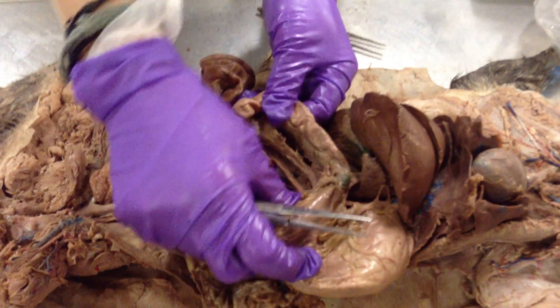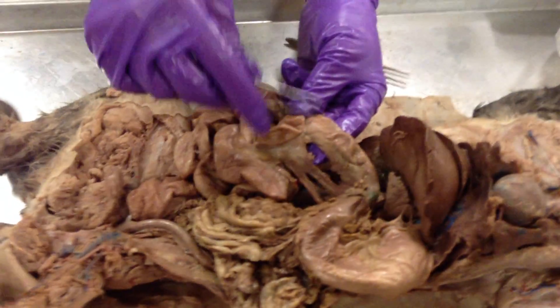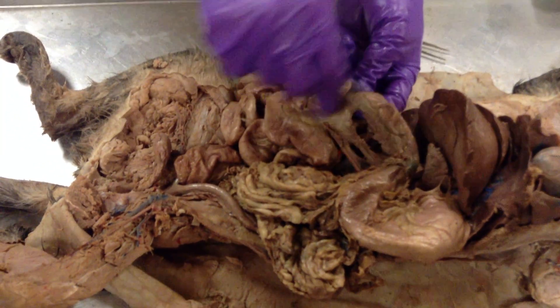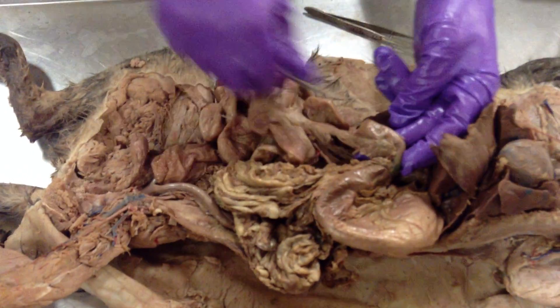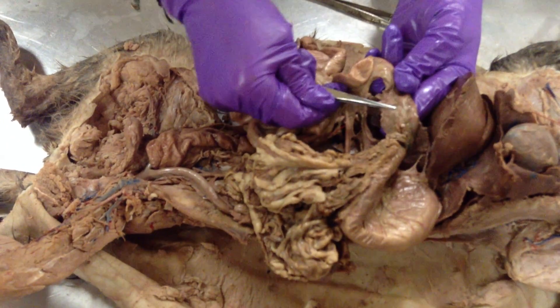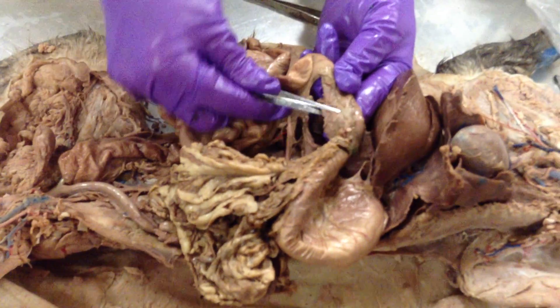You actually have a mesentery — the clear part next to the duodenum is considered the mesoduodenum, since meso means mesentery and duodenum is where it's located. Don't get confused though — the pancreas runs alongside the duodenum. On this cat the pancreas is small and cut, but you can see this lobular stuff — it's not mesentery, it's actually an organ. It has little circles if you look closely. This is the pancreas.